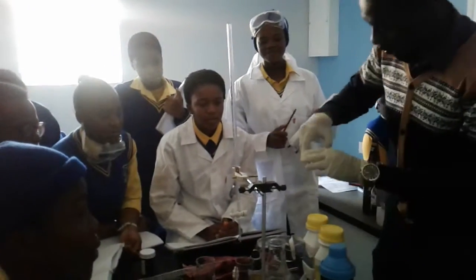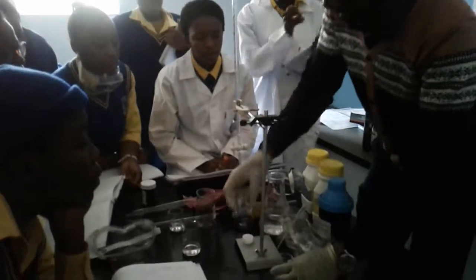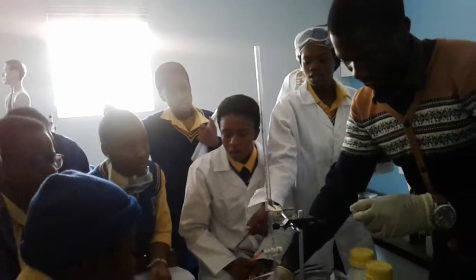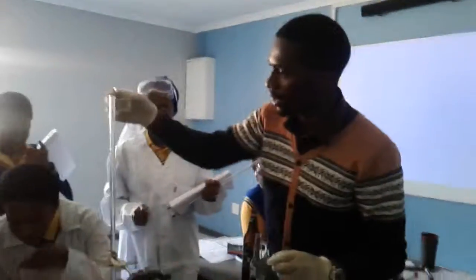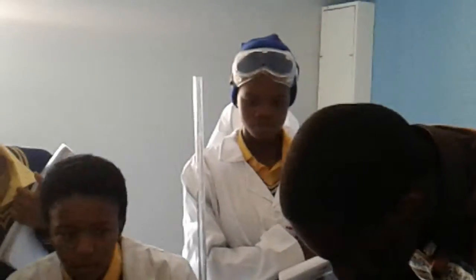Okay. Is it this one? Yeah. Guys, where did I put the sodium? The one I was telling you. Is that the one you took here? Alright, it's fine. Here is the sodium. You need to find it.